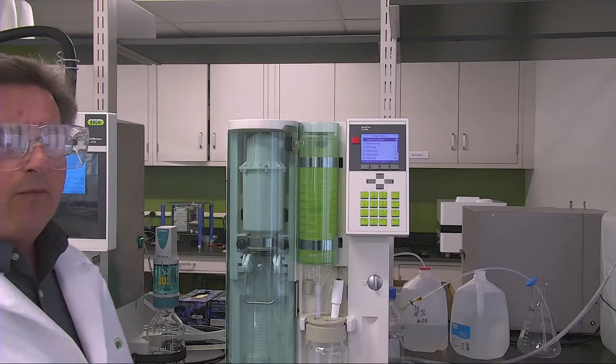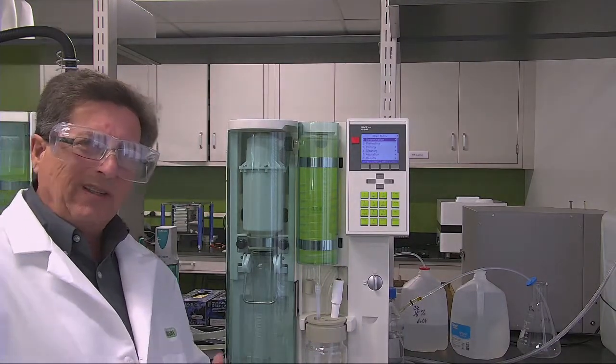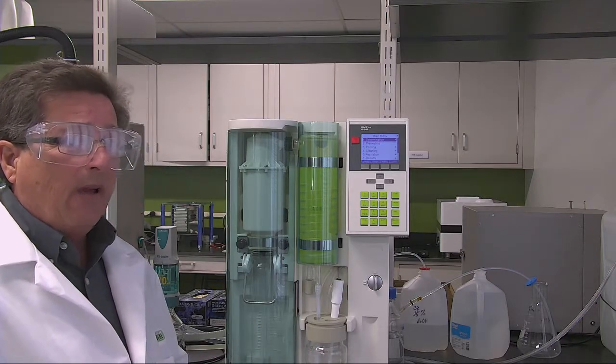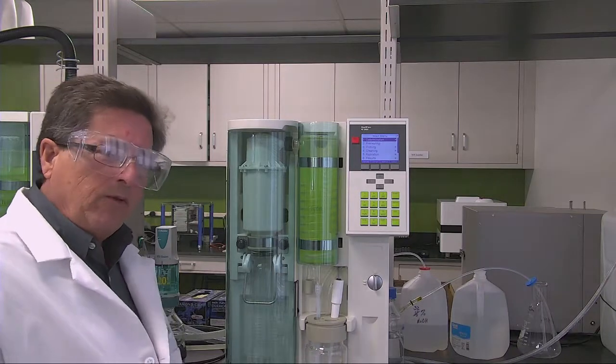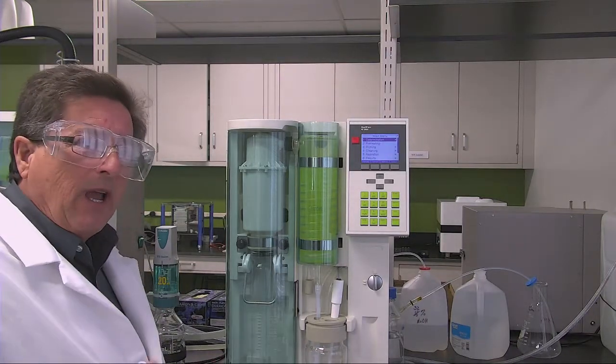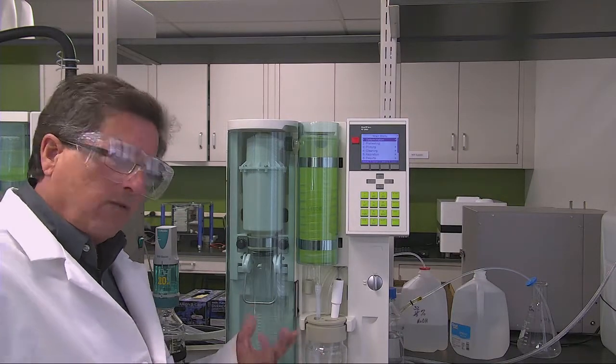One of the common problems that we find is a leak. If you have aspiration issues, you may have a leak in your system, or if you have low nitrogen, you may have a leak in the system. Let's see how we can address the leaks on the front of the K-360.